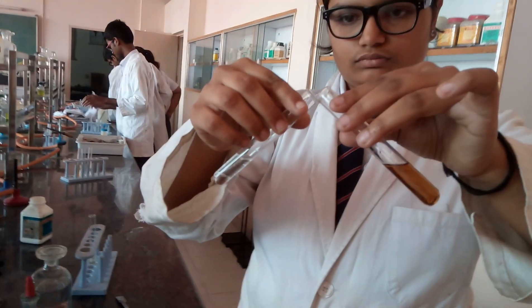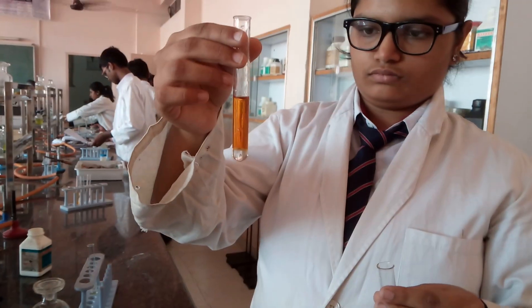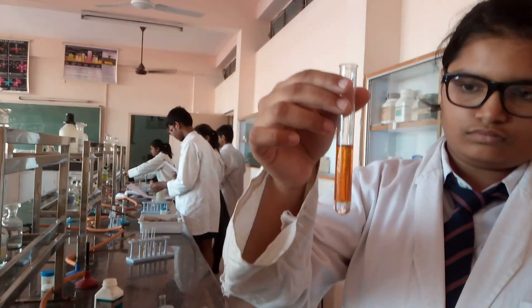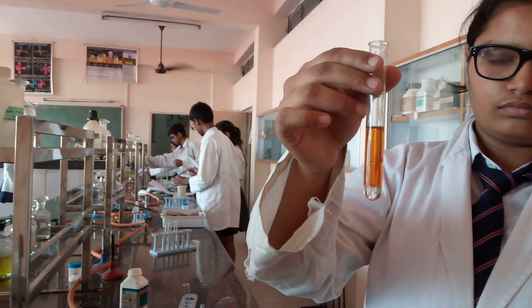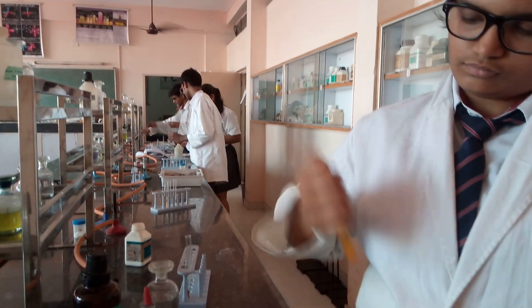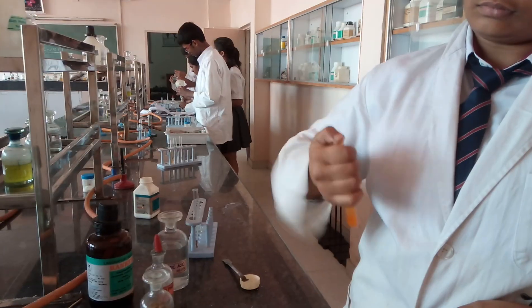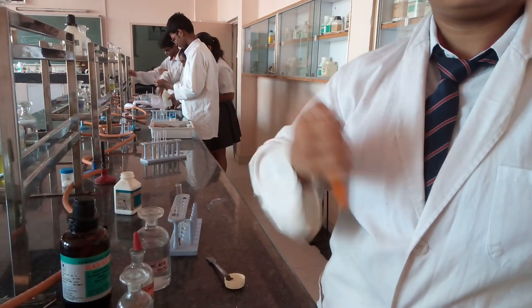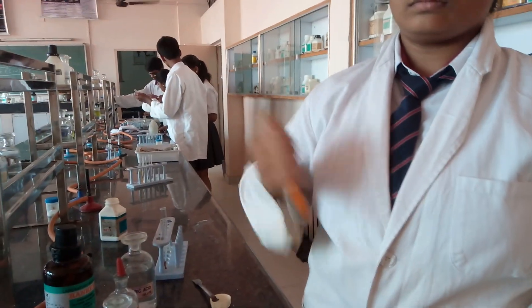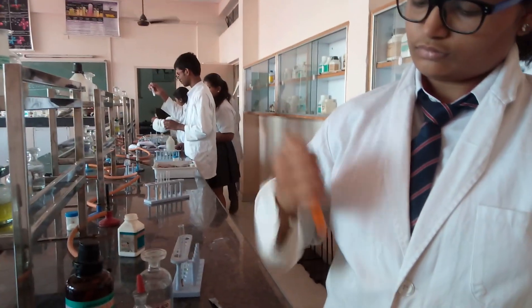Now your original solution has the organic layer added to it. Add 1 to 2 ml of chlorine water and wait. You can see there is a change in color in the upper aqueous layer, which means the iodide is changing into iodine. Shake the contents vigorously so that the I₂ formed dissolves into the organic layer. Continue shaking for at least 1 to 2 minutes so that the maximum iodine formed by oxidation of iodide, by chlorine water as oxidizing agent, converts into I₂.